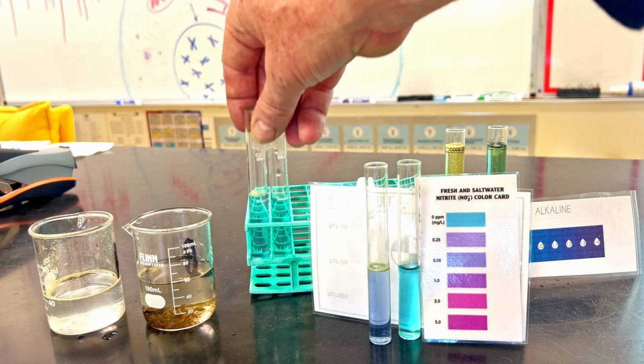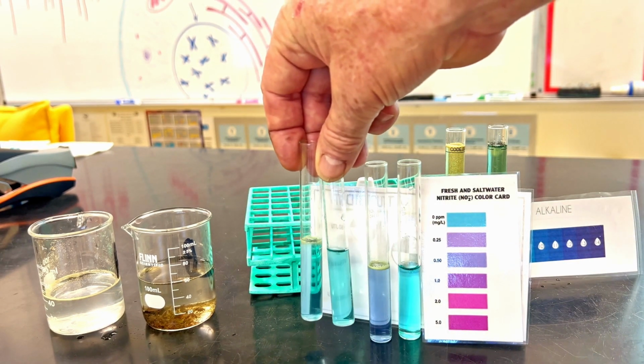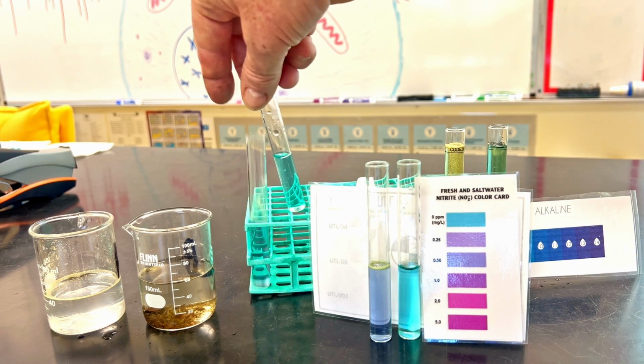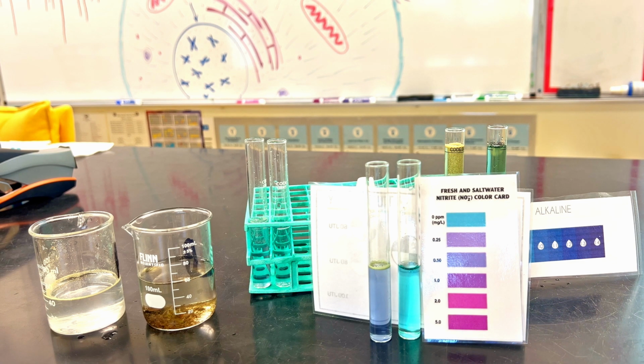Now for what it's worth, the ones we did just drop in, we can see the color is appearing. It just hasn't been long enough to get good color yet. So we're just going to use these, which I did a little bit earlier. Now we're going to transfer and I'm going to do the turbidity test, but I have to arrange my camera a little bit differently for that one. So here we go.